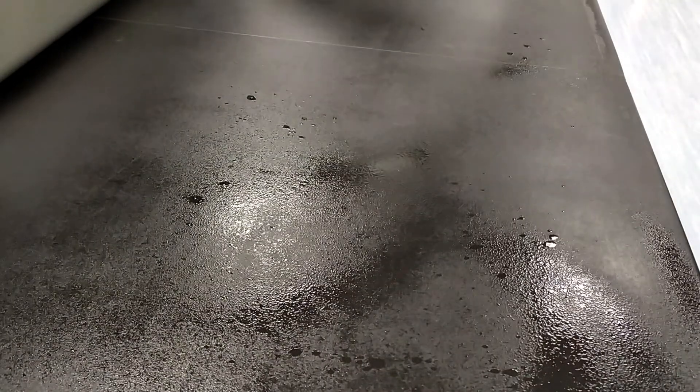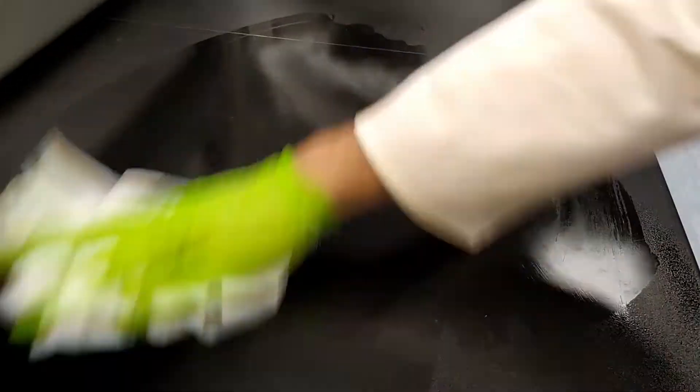You spray down the work area with some 70% ethanol and then you wipe it down as completely as possible until you have a nice clean surface, right?